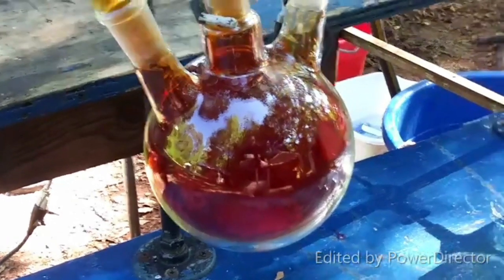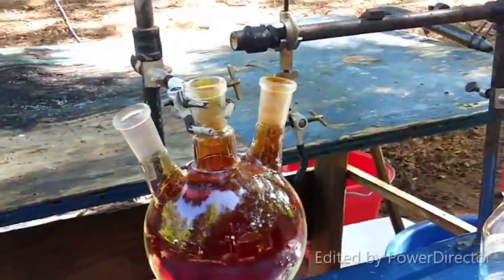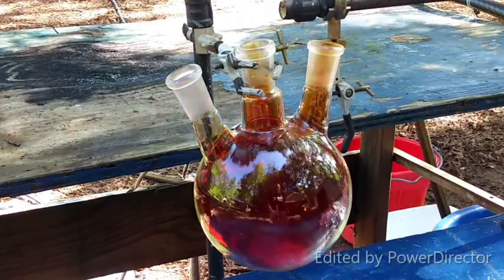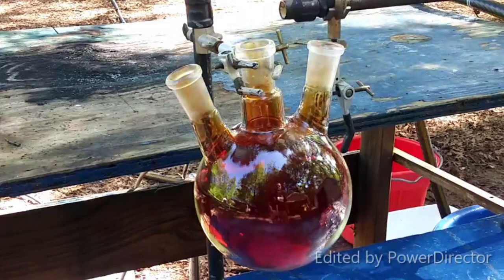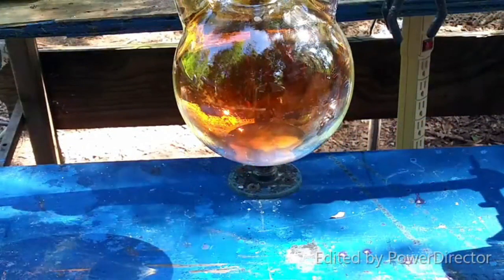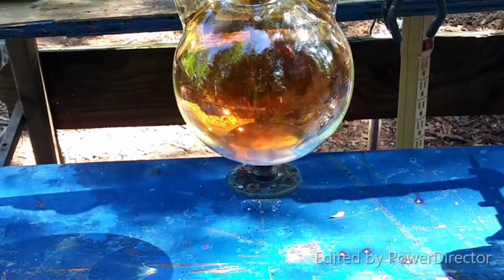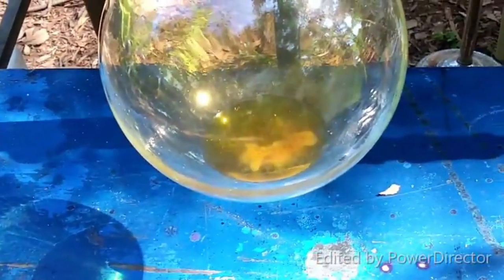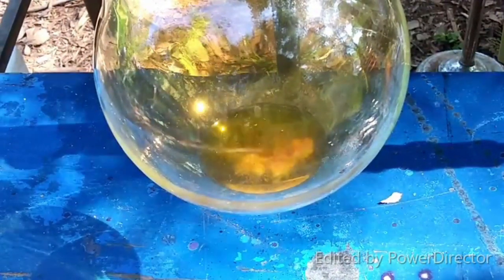Look at that go. That's great. As the gases are clearing out, I can see it's yellow. Well, kind of yellow. That is the correct color. Of course, there's a lot of nitrogen oxides probably still dissolved in there. But still, uranyl nitrate should be a fluorescent yellow-green. Excellent. All things are going as they should.